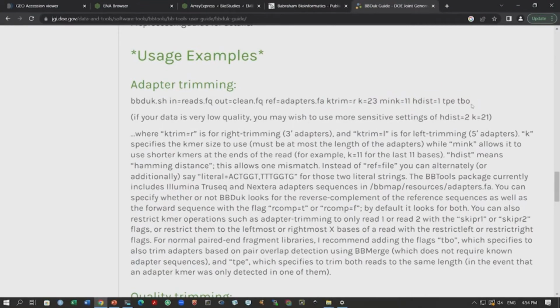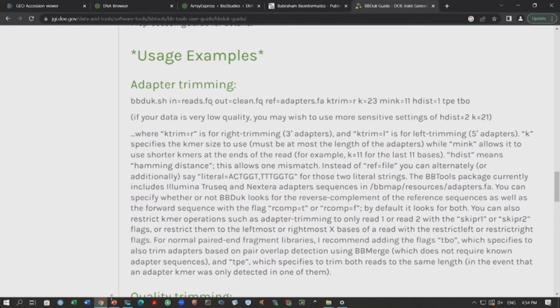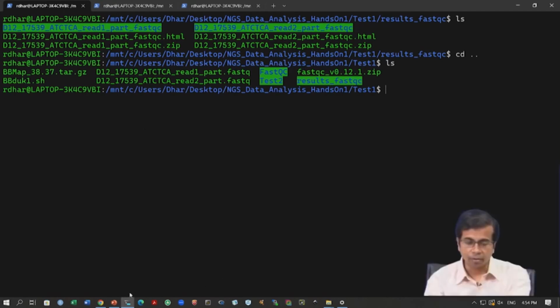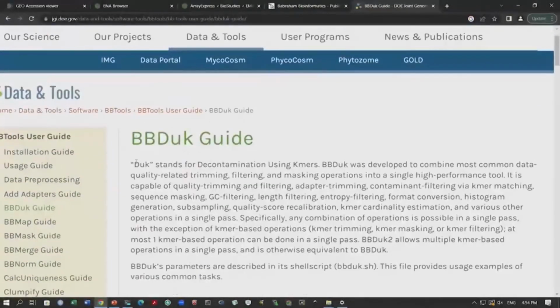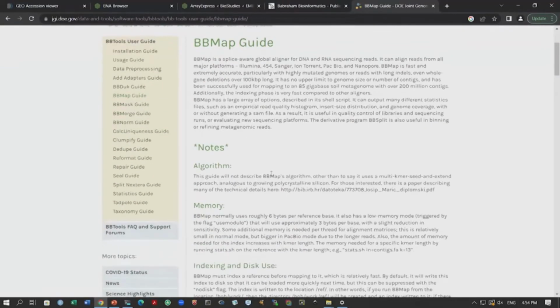So, let us actually run this through our command line. What I have done is I have optimized these parameters, and I have stored these parameter values in this file. So, the first step is setting up this BBMap. You can download this BBMap from here. You have this BBMap download here. You can download this tar file here, and you need to set this up.